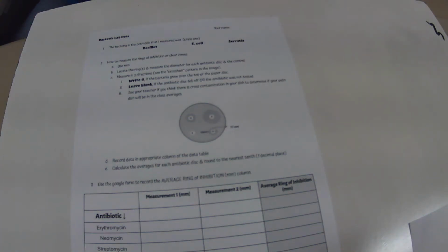Olson. I know you can't see my face, but I'm going to write some things on the whiteboard, which is what this is right here. I also want to show you guys the Petri dishes, hence why you just have a downwards image.